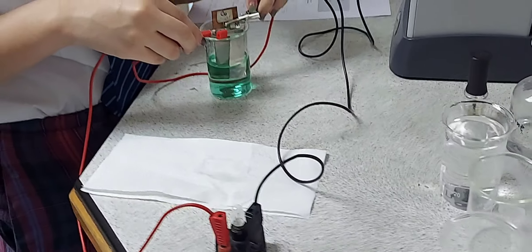Hope you enjoyed this experiment. You can see the clear electroplating that has taken place on the copper plate. We now wash the electrodes with propanone to remove any residual nickel sulfate on the electrodes.